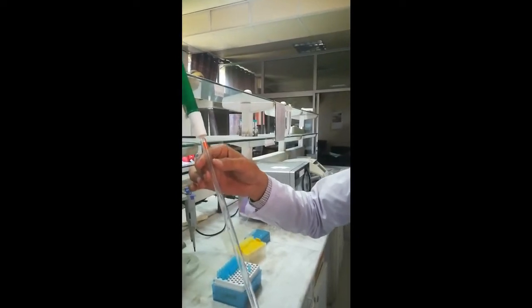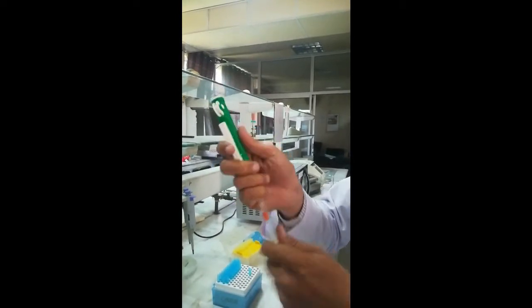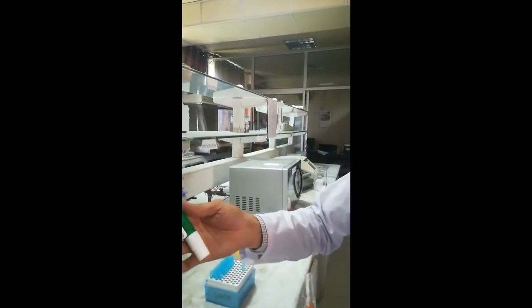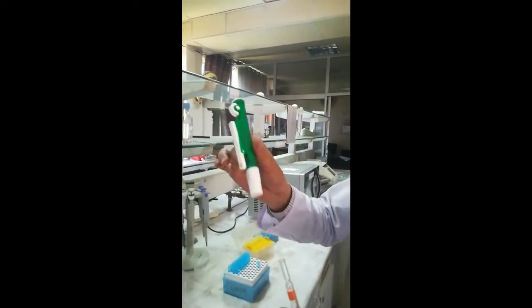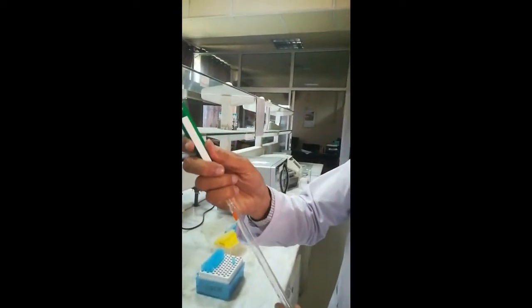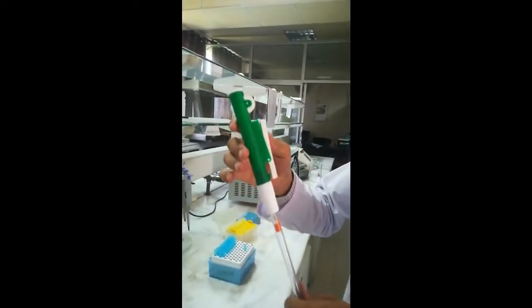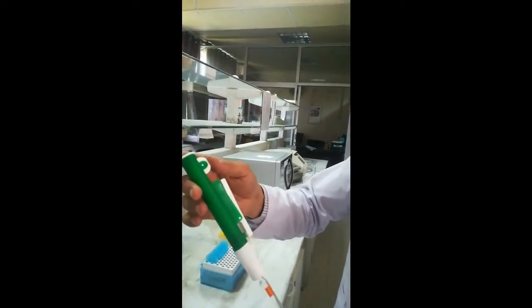Above the glass pipette we have attached a pipette pump — it is called a pipette pump. It is a gadget that is attached with the pipette to suck solution. We attach this pipette pump with the glass pipette and fix it in place. This pipette pump has two buttons.